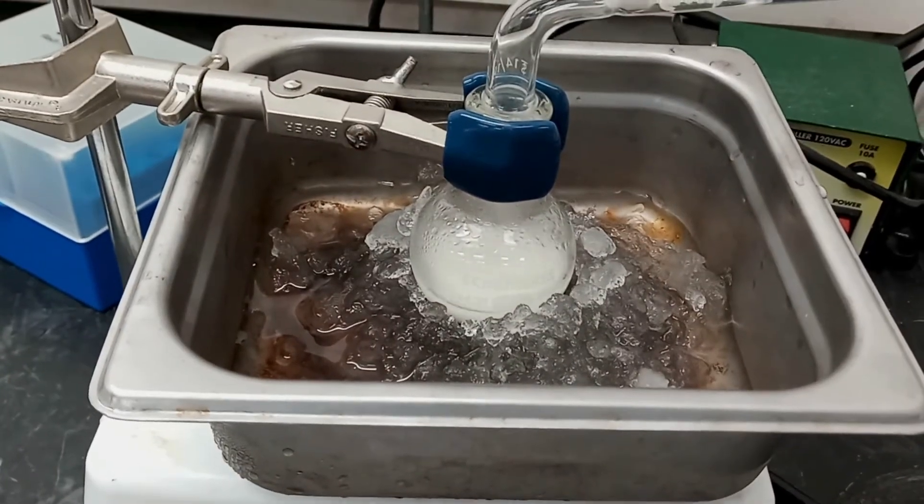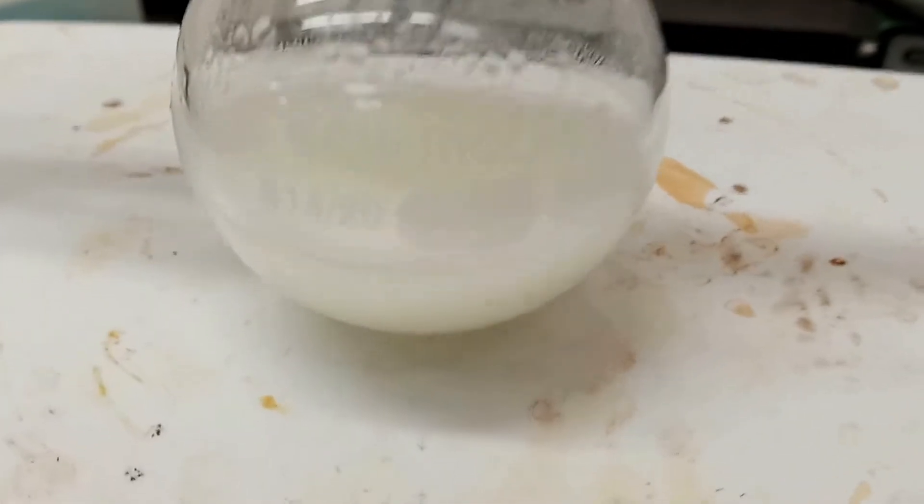Once everything was added, we removed the ice bath and allowed the solution to continue to stir for 30 minutes at room temp.